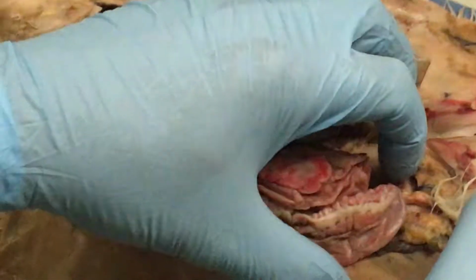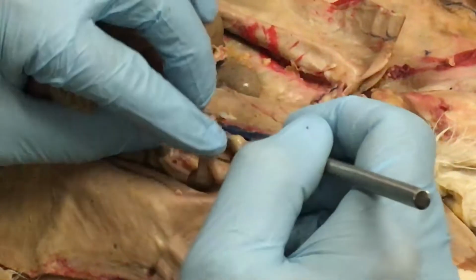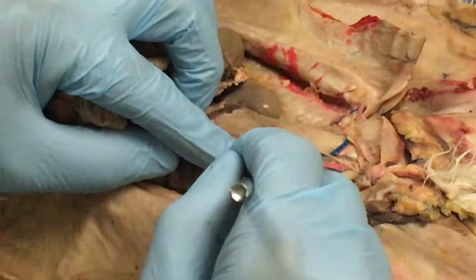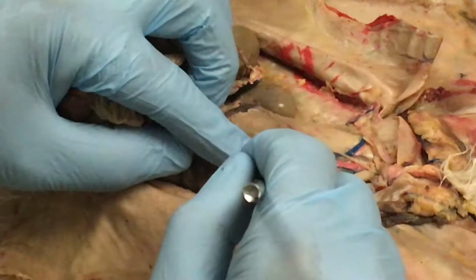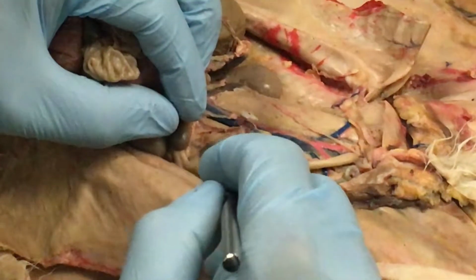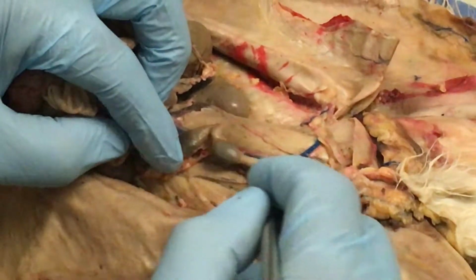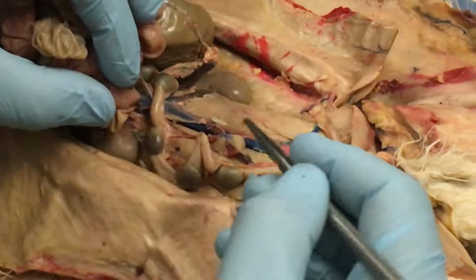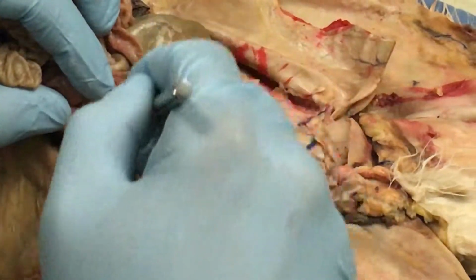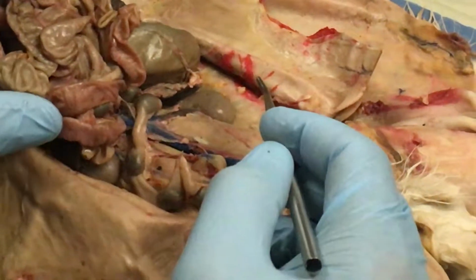Okay, large intestine. I'm going to be very, very obvious that I want the large intestine. As a matter of fact, I'm going to put a pin right in a piece of poop right here. Okay, and there's only one thing it can be, and that's a large intestine. Now this is not a very large intestine, so make sure you look at other rabbits. We've got large intestines that have pellets all through here. It almost looks like one big pellet just in little pieces. Okay, so that's the large intestine.